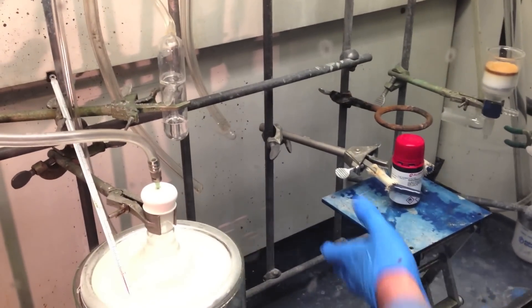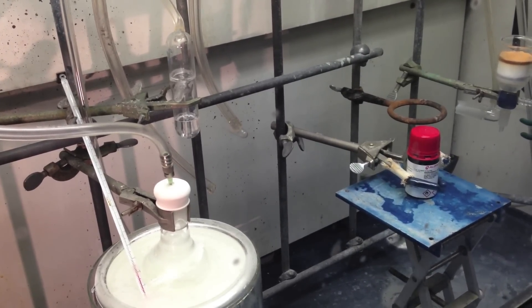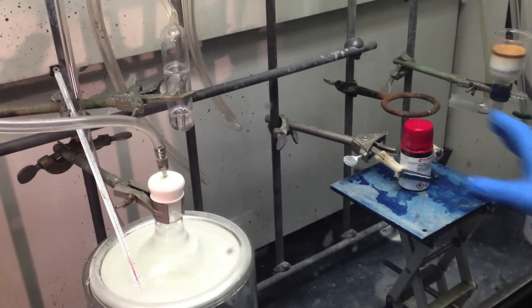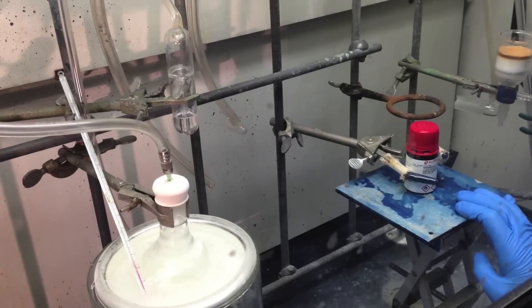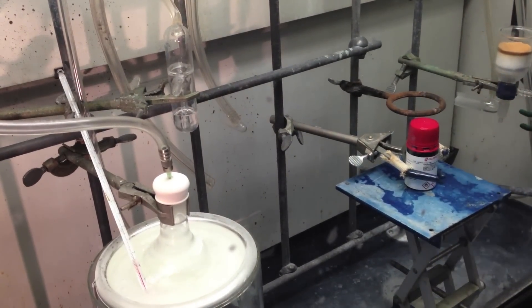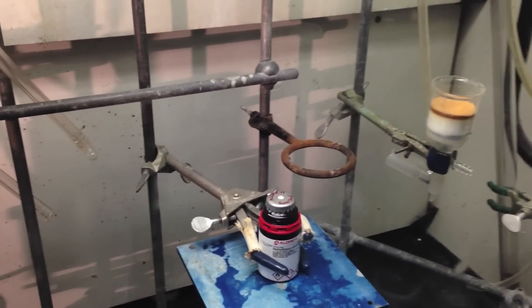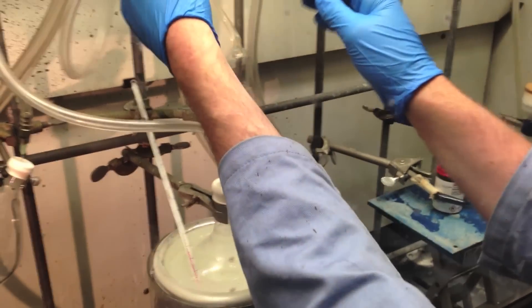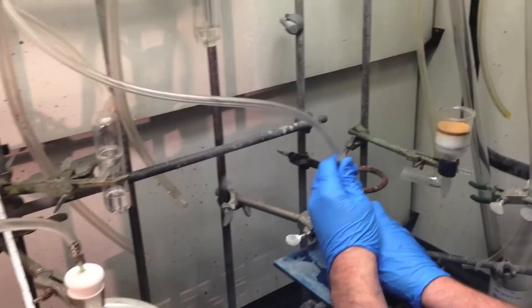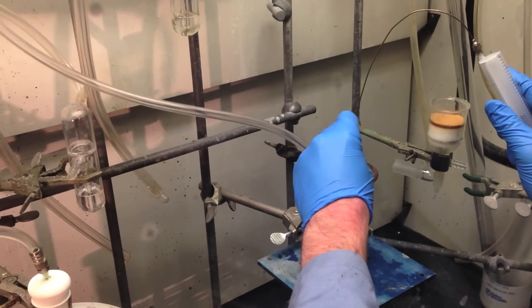Methyl-lithium is an alkyl-lithium reagent, which means it is very reactive — it reacts violently with water and air — and for that reason we need to use special precautions for transferring it into the flask. We've clamped the bottle in place, and also put a lab jack underneath it to prevent the bottle from slipping. First I'm going to remove the cap — it comes with a SureSeal cap on top, which prevents air or water from entering the bottle. Into that cap we are going to insert a needle of nitrogen.